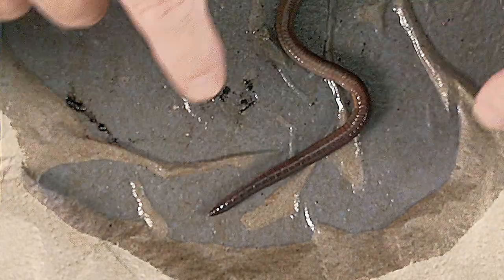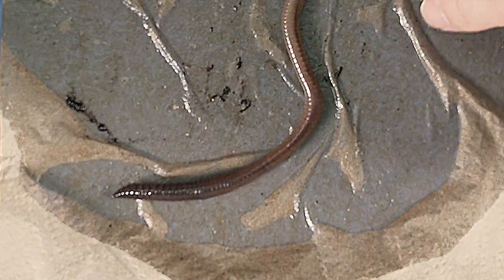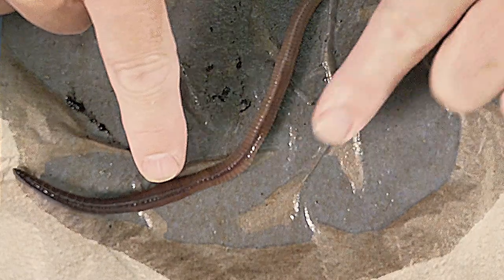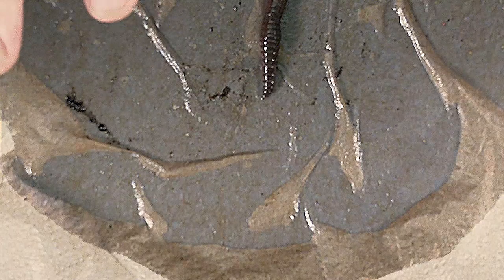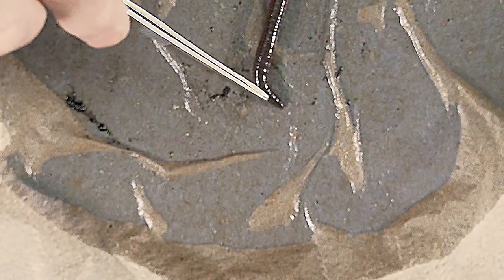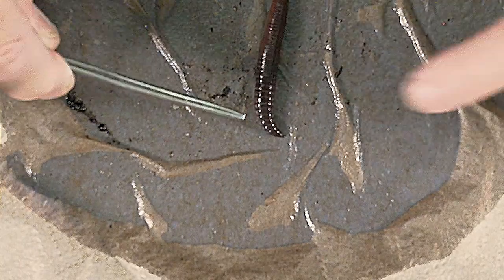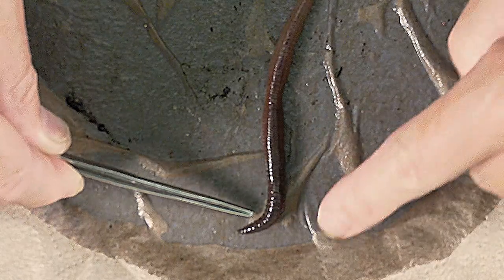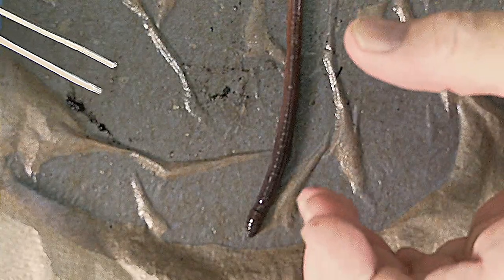By observing how the animal moves, you get a good idea of its musculature. You can clearly see the animal gets long and thin, and then gets short and fat and pulls the body along. In order to get very long and thin, it contracts its circular muscles — muscles that encircle the body — which makes it thin and therefore long. In order to get shorter and fatter, those circular muscles relax.